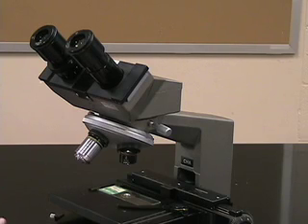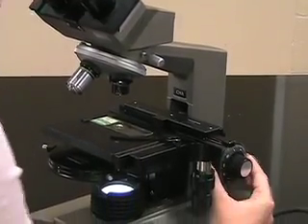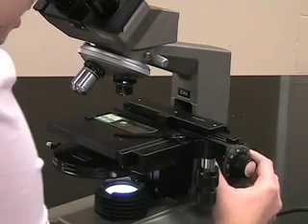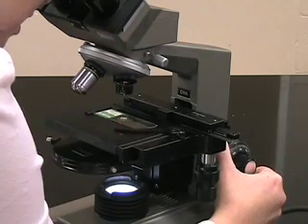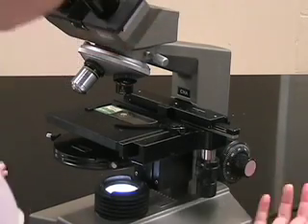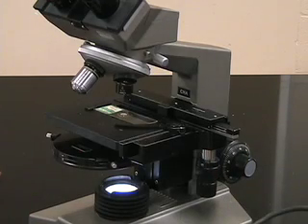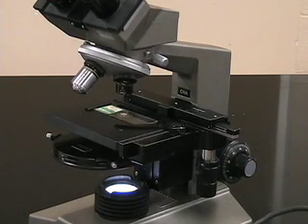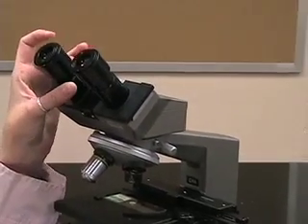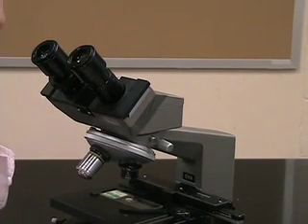When focusing on your specimen, first look down into the microscope and close your left eye. Using the coarse focus — the big knob — turn it so the stage comes up and your specimen gets closer until you actually see it on your slide. Once you've done that, switch to the fine focus, which moves the objective lenses in smaller increments until your sample is sharper. Then open your left eye and close your right eye. The left ocular lens has its own focus ring, so rotate it until you see a nice crisp image.